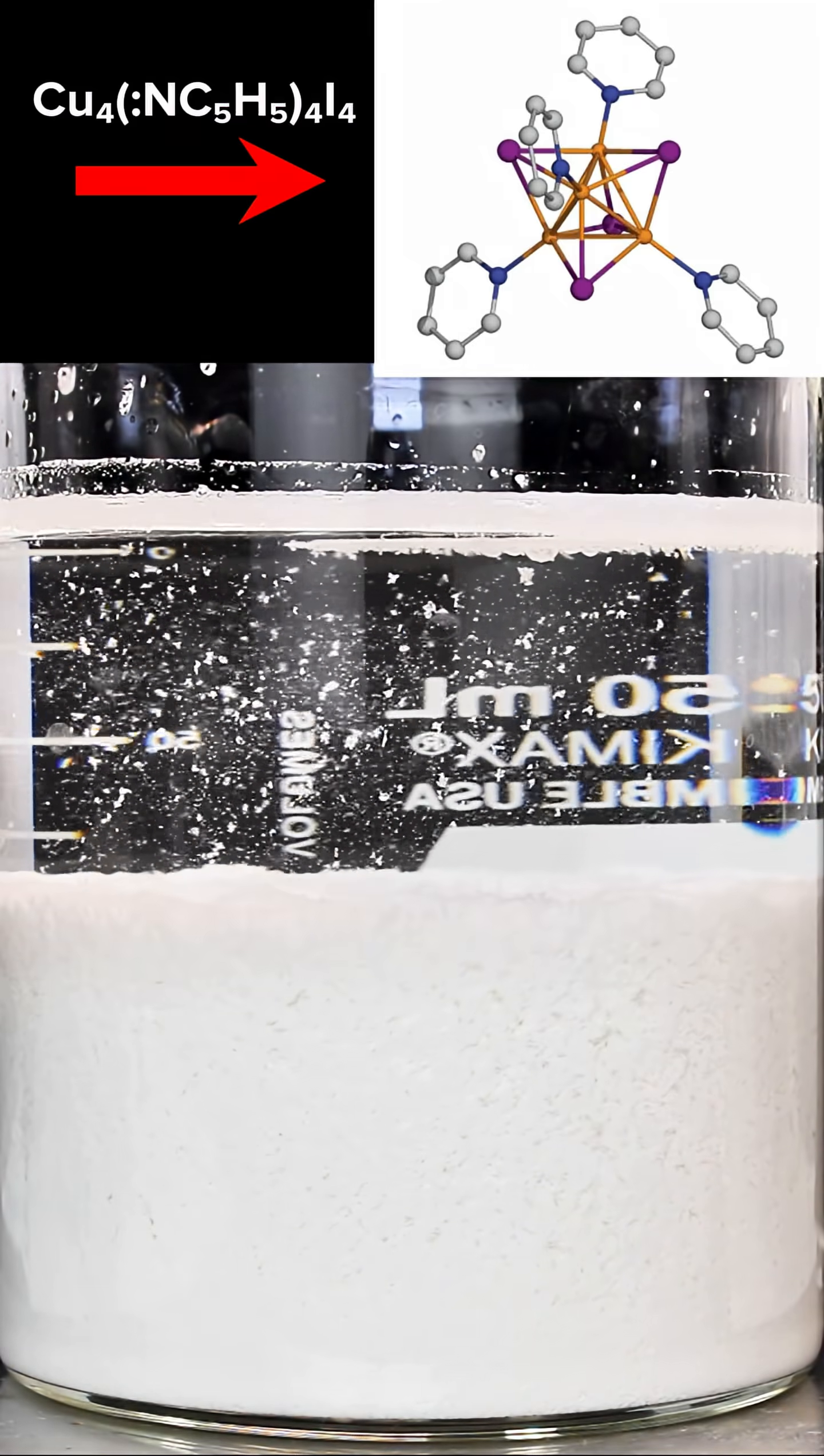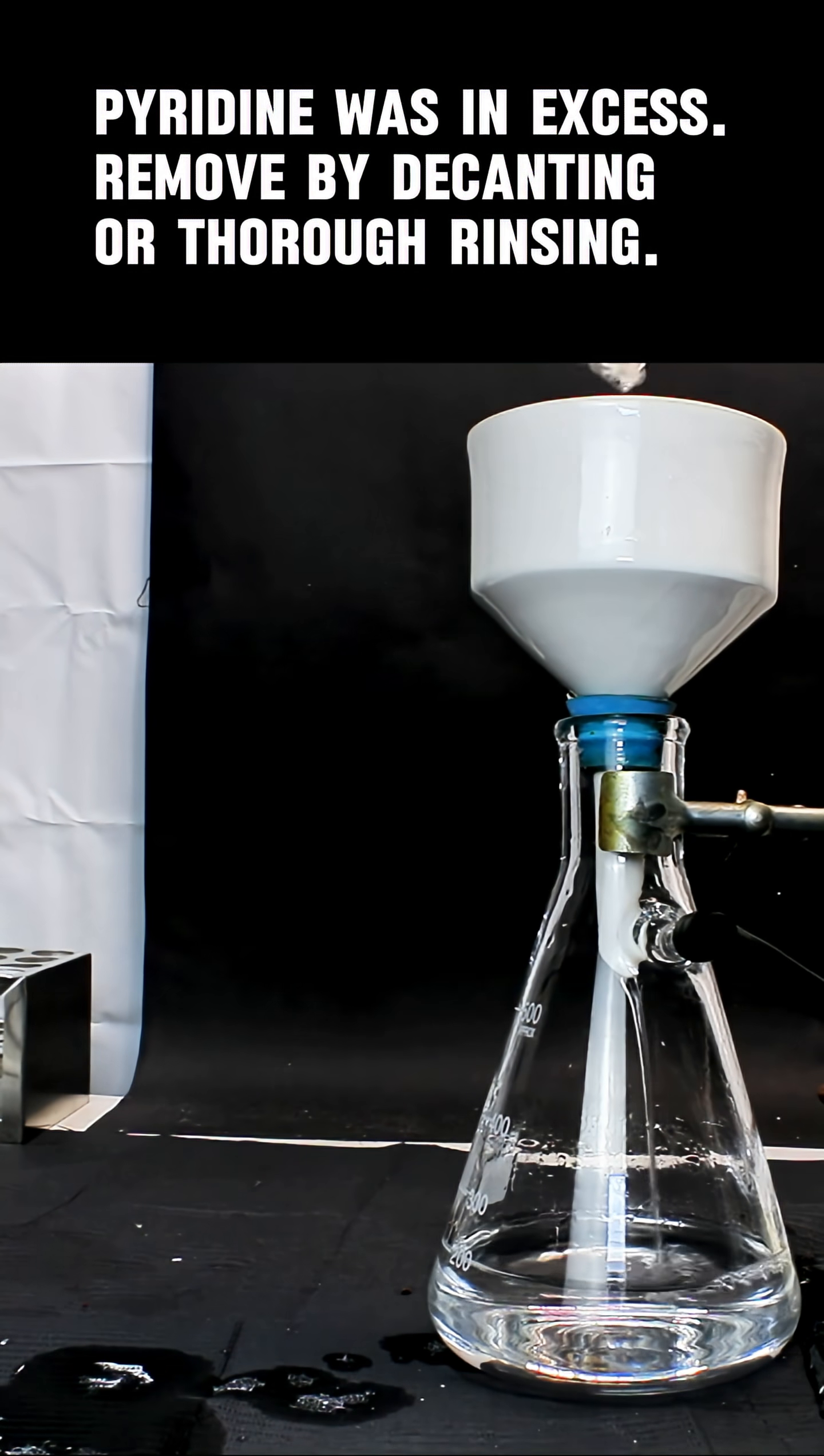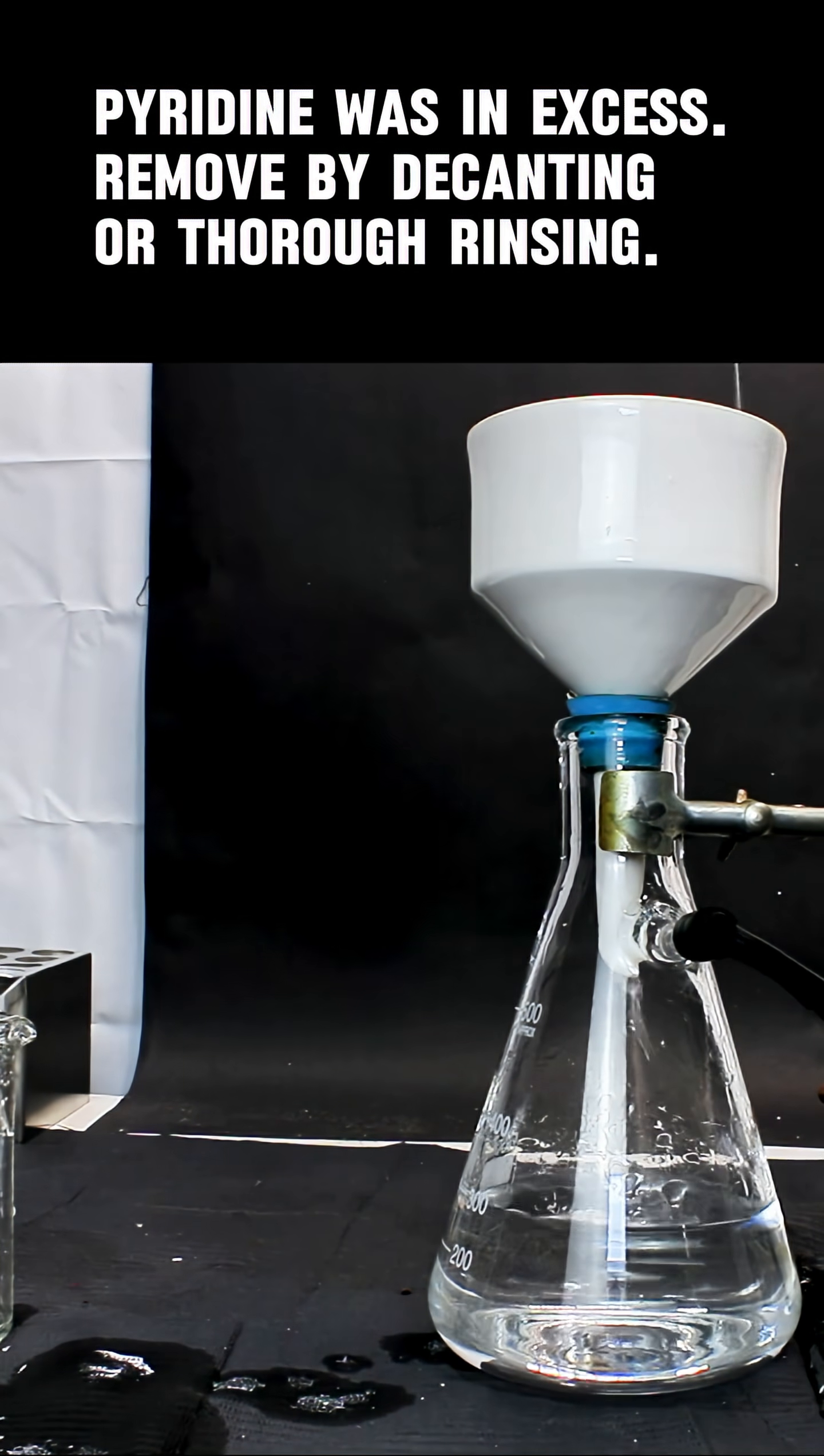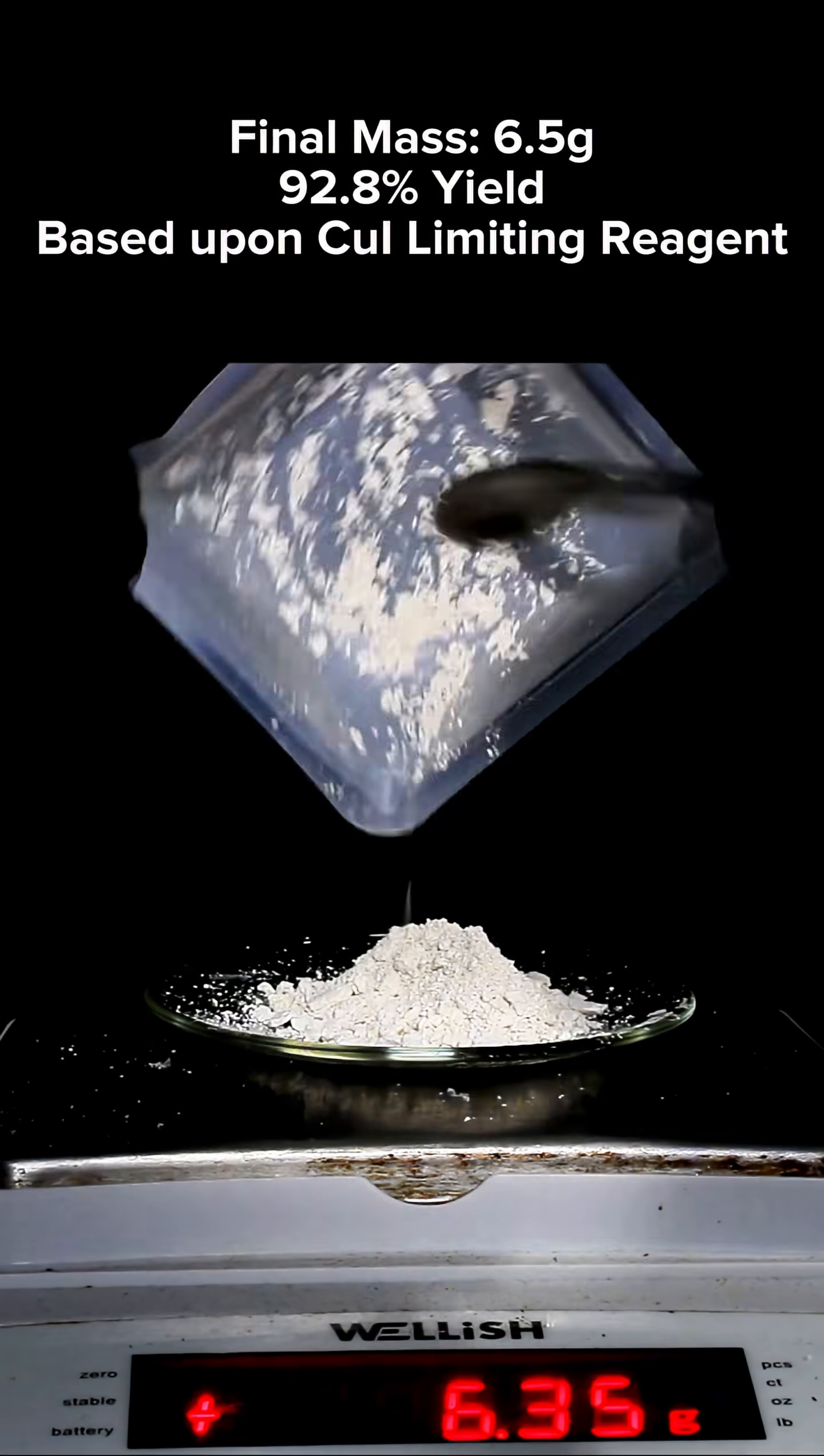To clean this up, I simply rinse it with a bunch of water and then collect it in my Buchner funnel. Once it's totally dry, I weighed it and calculated a 92.8% yield, which I think is pretty good.